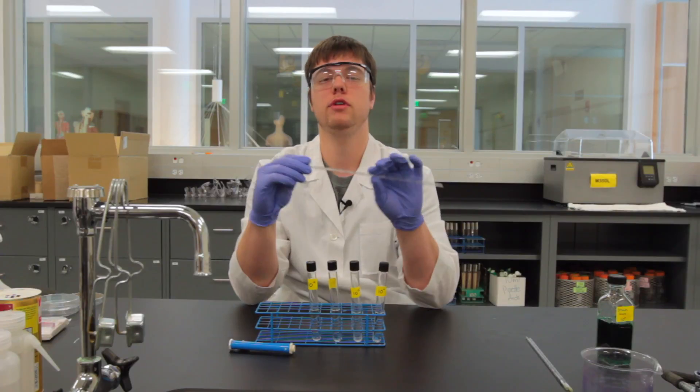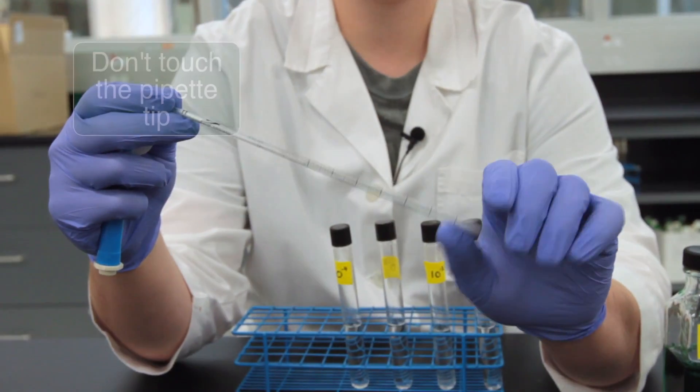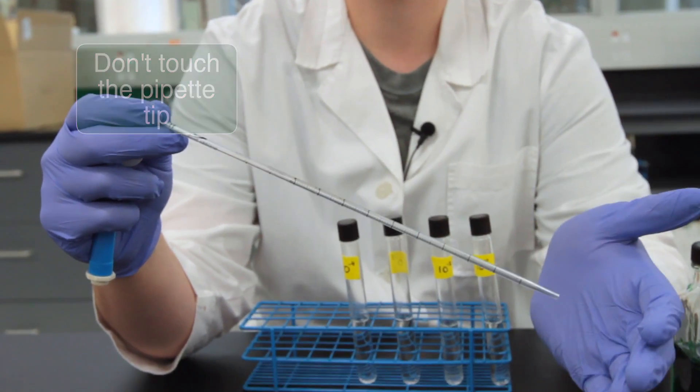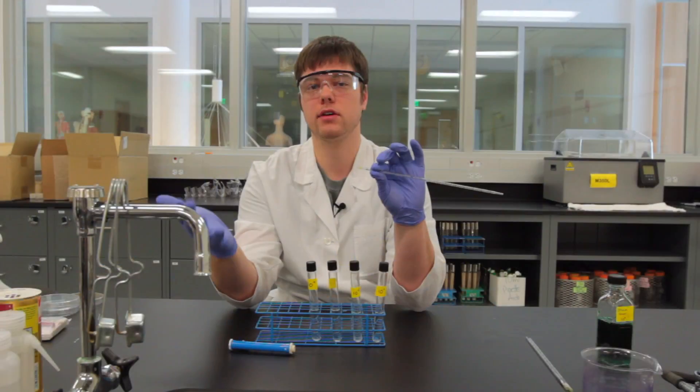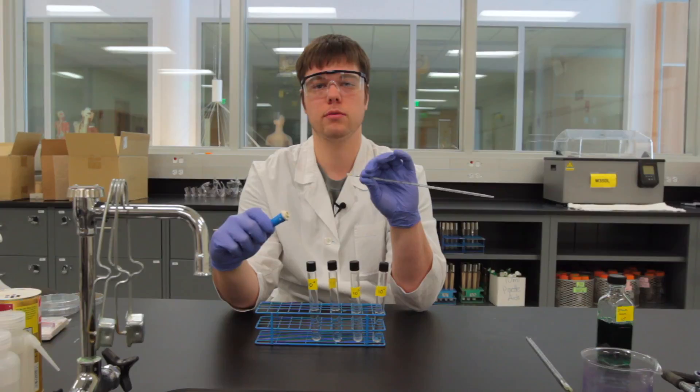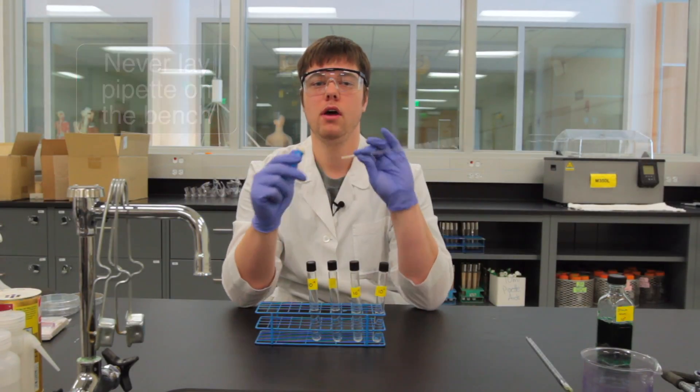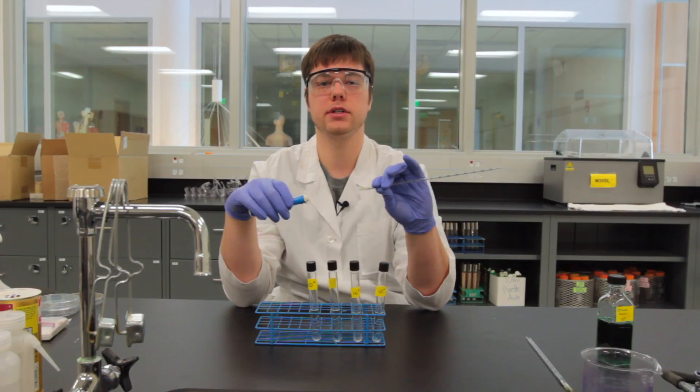When we use our pipettes, we want to do the very best we can not to touch them on the bottoms but make sure that we hold them and touch them on the tops because we want to keep them as clean and as aseptic as possible. So they shouldn't be sitting on the bench. We should always be trying to hold them and keep them away from any possible contamination.